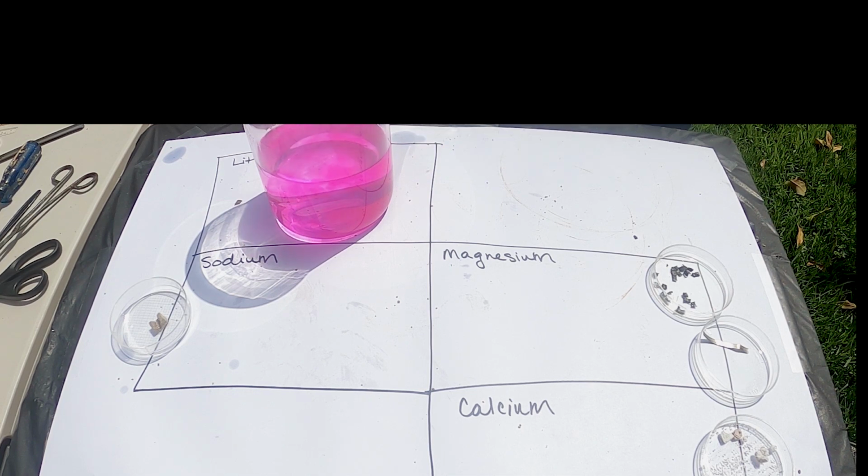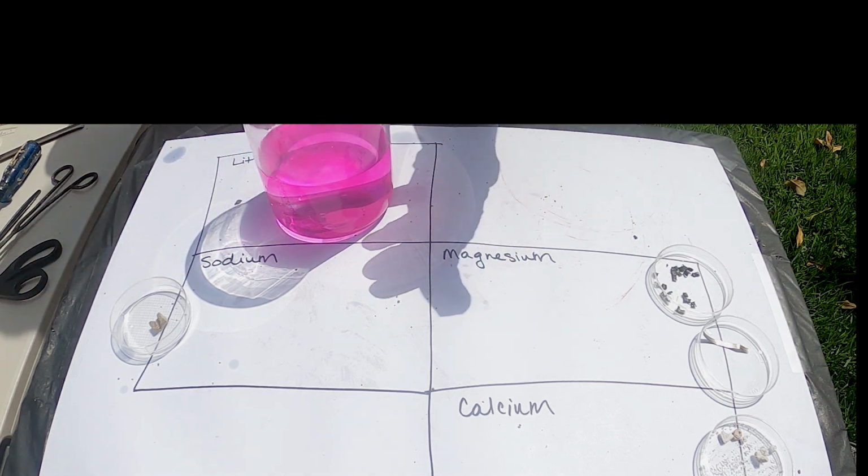There's actually a set of chemical reactions that we're going to be going over in chapter 3, and you must know that metals with water produce metal hydroxides, and you can see that here by our very basic product.